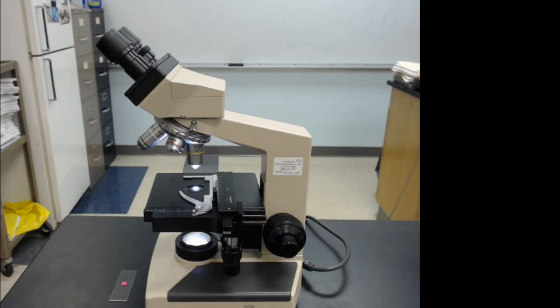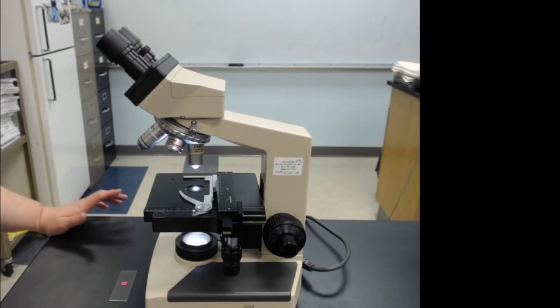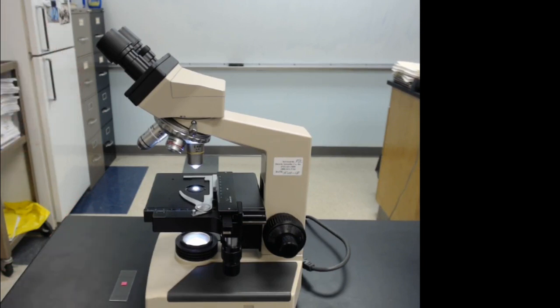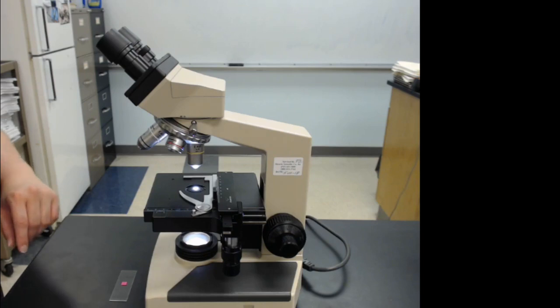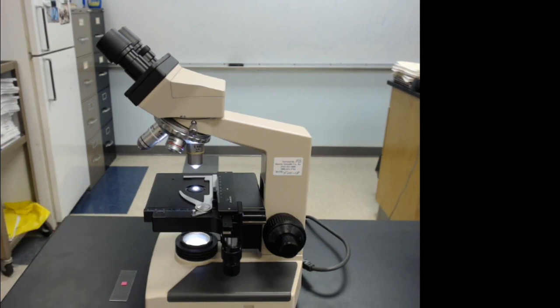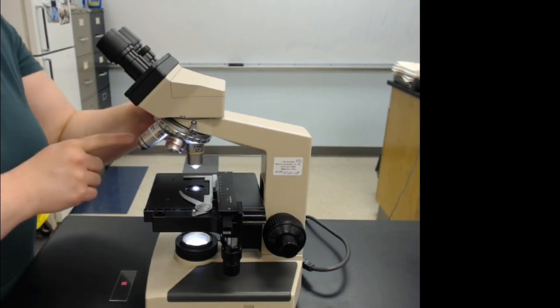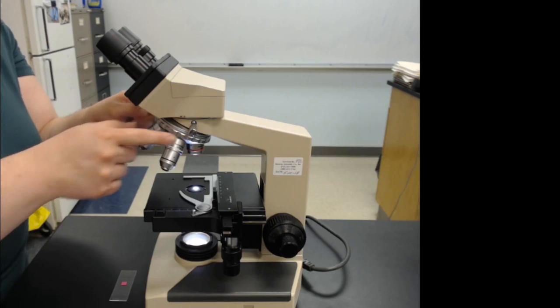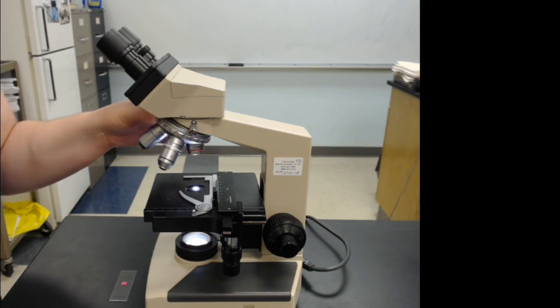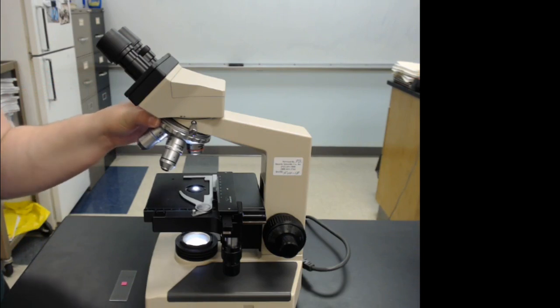Now that you know all the parts of the microscope, let's talk about how to actually focus a specimen — this is part four on your lab. You always want to begin on the lowest power objective, the 4x. Rotate it into place and you will hear it click — you'll know when it clicks because it doesn't want to move after that.